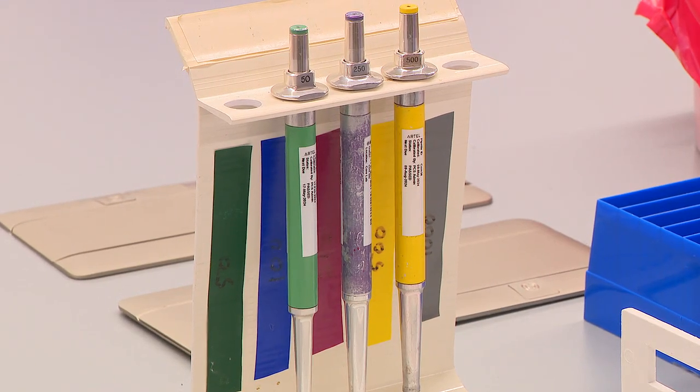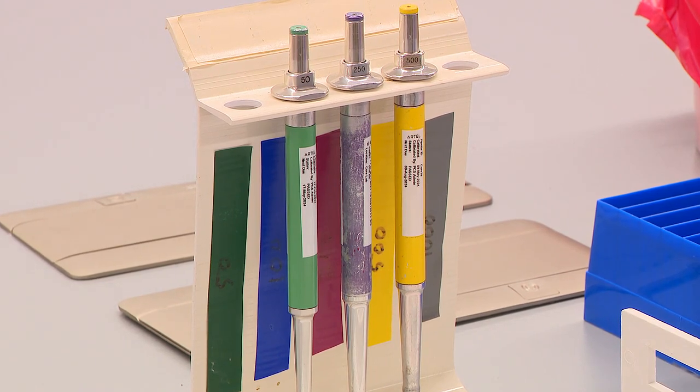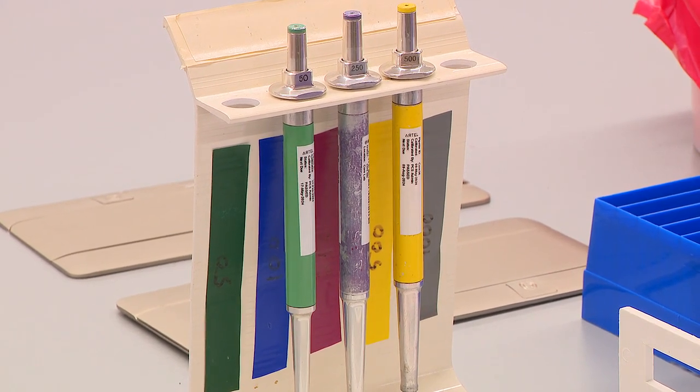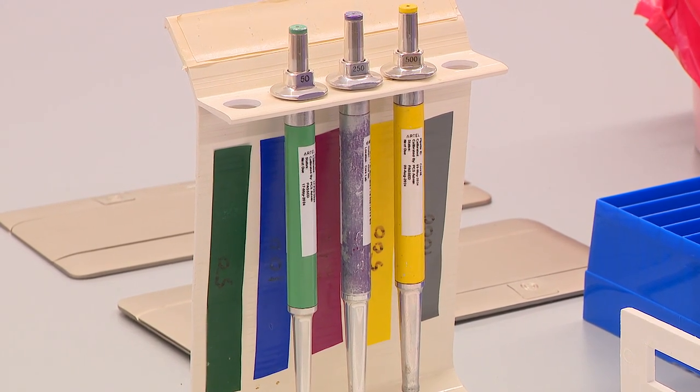MLA fixed volume pipettes are general purpose pipettes for sampling and dispensing liquids when accuracy, precision, and convenience are required.